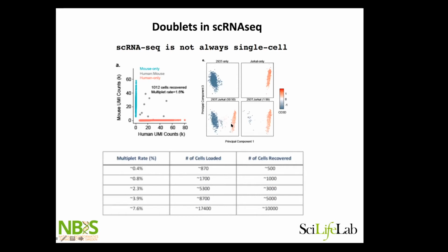Or in this case, mixing two cell types, and you get some cells here in the middle that express genes from both cell types. There are some estimates on the 10x website, some tables on the estimated rates of doublets depending on how many cells you loaded and recovered, where you can know in advance that, okay, I know that 5% of my cells are probably doublets, and keep that in mind all the time when you do analysis. The problem is knowing where my doublets are.